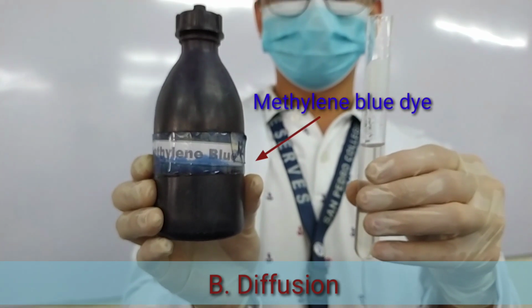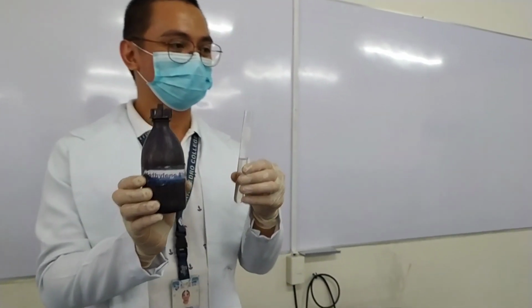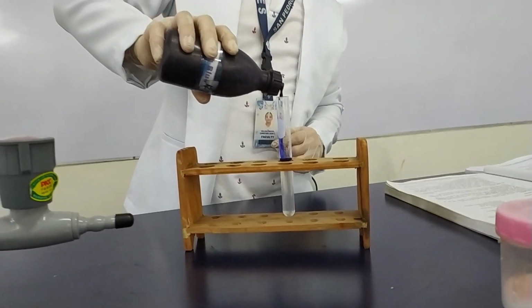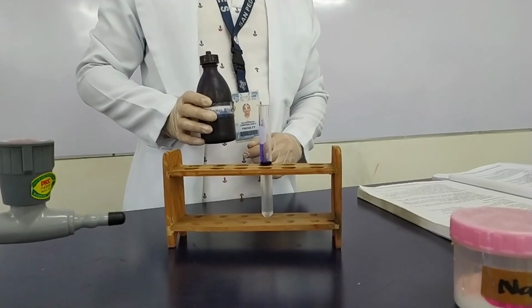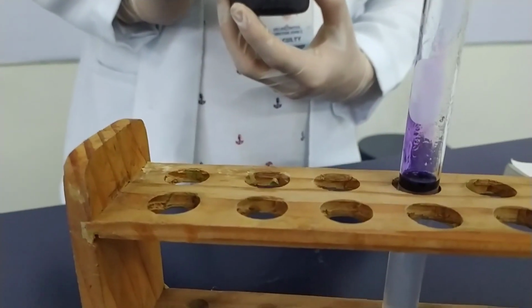And then we have our procedure letter B, which is diffusion. So, in a prepared gelatin in a test tube, add 5 drops of methylene blue dye on the surface of the gel.